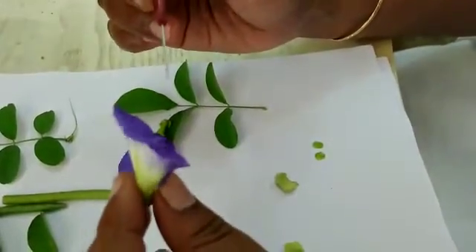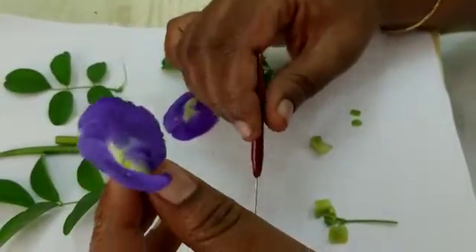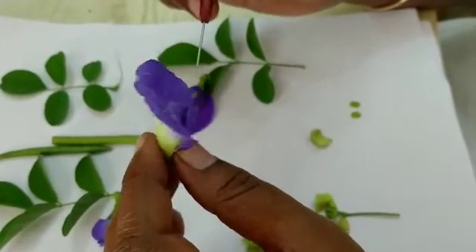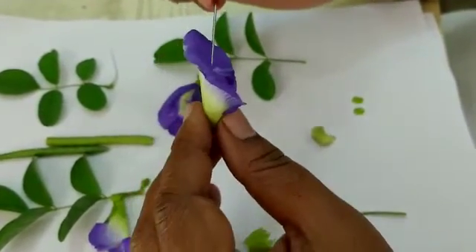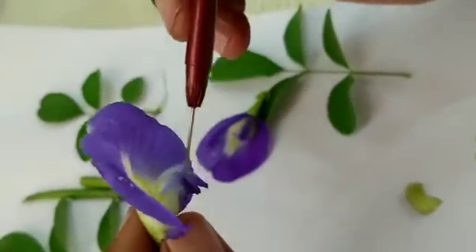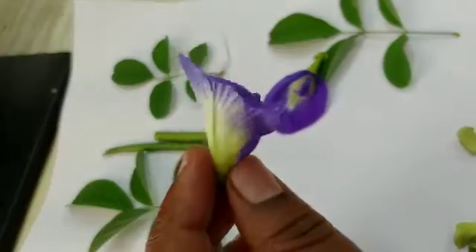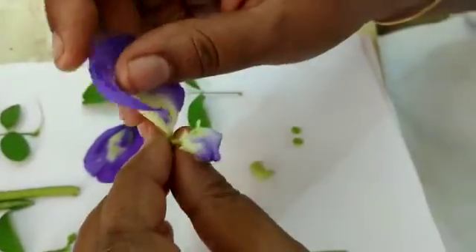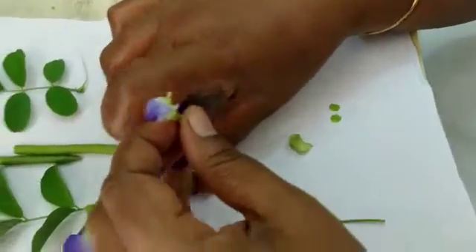Now we will see the petals. These petals are five in number; sepals are also five in number. The one big petal present is called the standard petal, and then you will see the wing petal, and then the keel petal. Let us remove the petals one after another. This is the standard petal, which is very big in size.